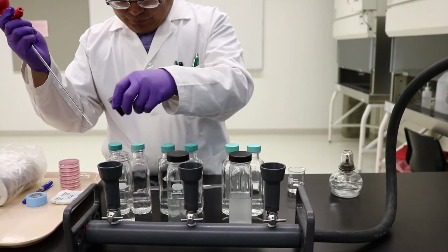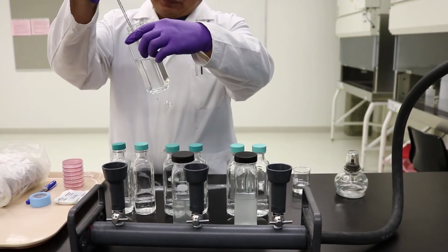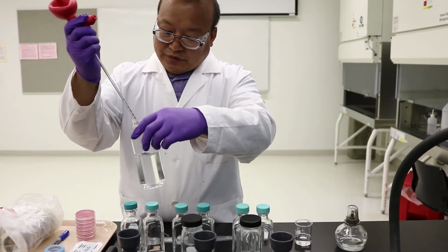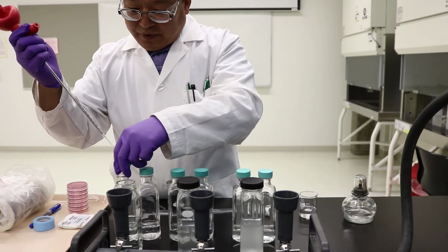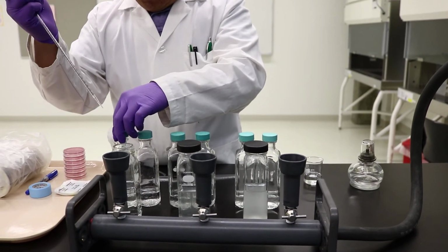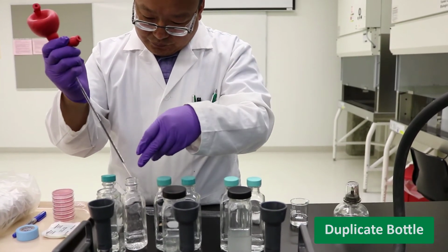When starting the filtration, we always start with the most diluted sample. Take 1 ml sample from the 1000 times dilution sample bottle and transfer it to a bottle with 30 ml of dilution solution. Repeat this as you will need to prepare 2 bottles of each dilution sample in order to have duplicate data.